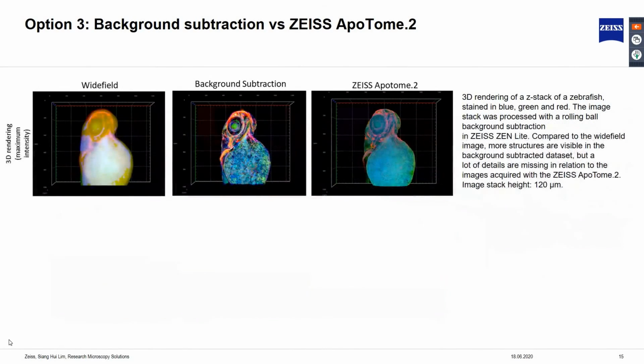Here is another example of comparison between image from background subtraction and image acquired with apotome. What we have here is a 3D rendering Z-stack of a zebrafish stained in blue, green, and red fluorescence. Similar to earlier observation, more structures are visible in the background subtracted dataset when compared to the Widefield image. However, when you compare the image with the apotome system, you will see that a lot of details are missing.